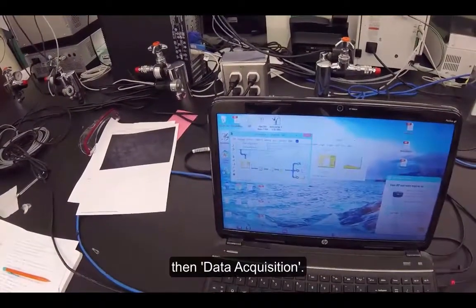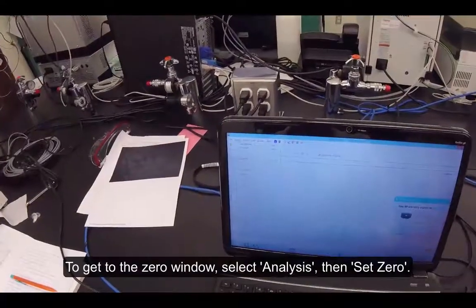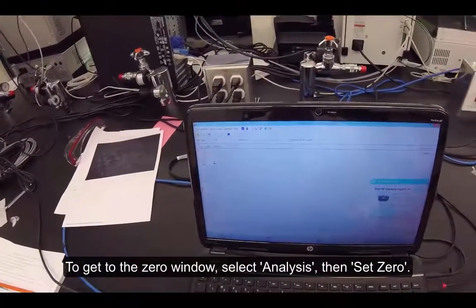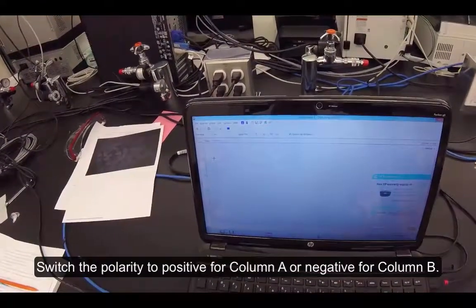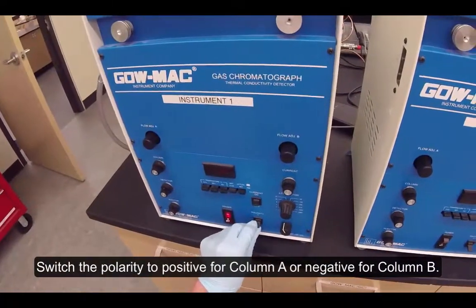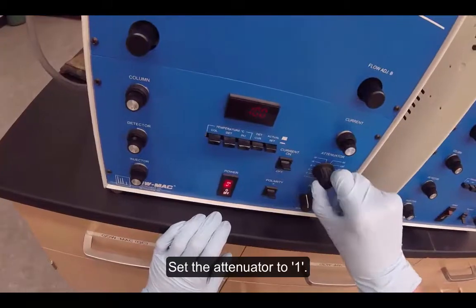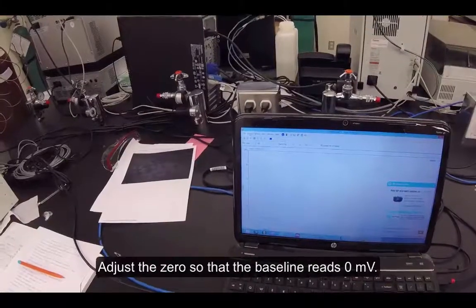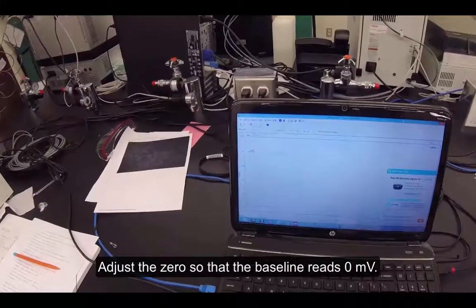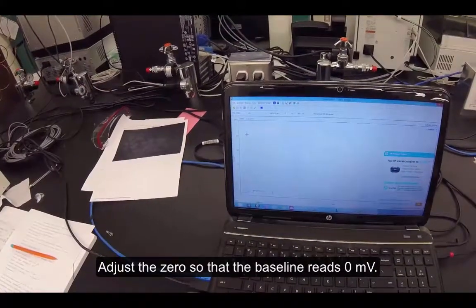Select Monitor, then Data Acquisition. To get to the zero window, select Analysis, then Set Zero. Switch the polarity to positive for column A or negative for column B. Set the attenuator to 1 and adjust the zero so that the baseline reads zero millivolts.